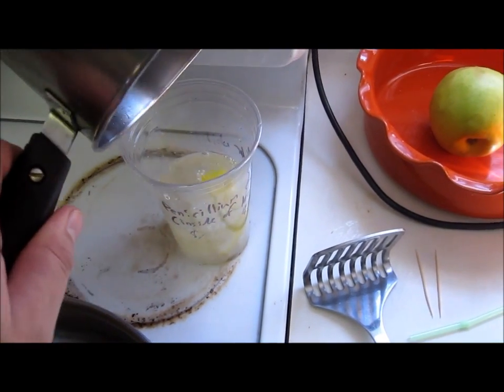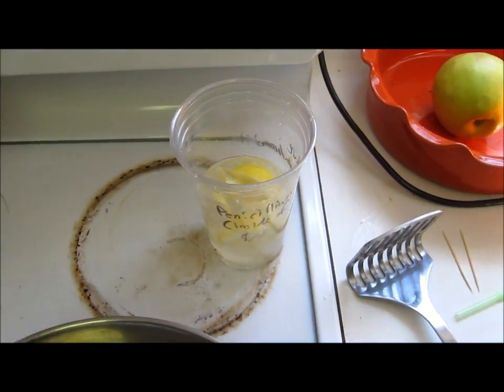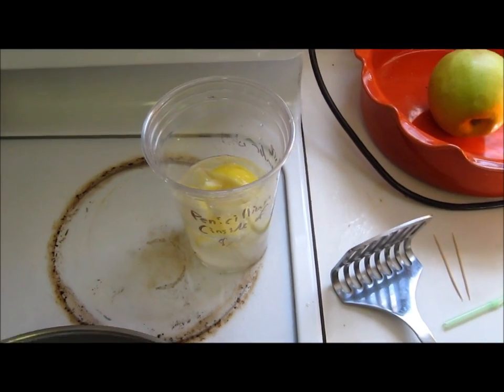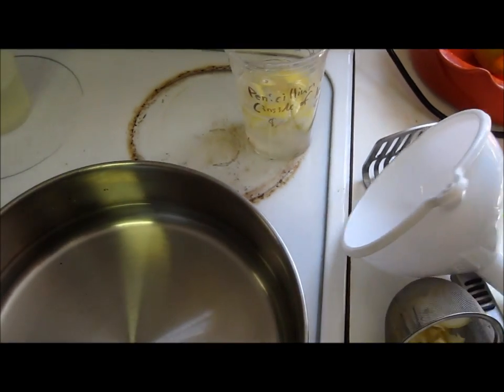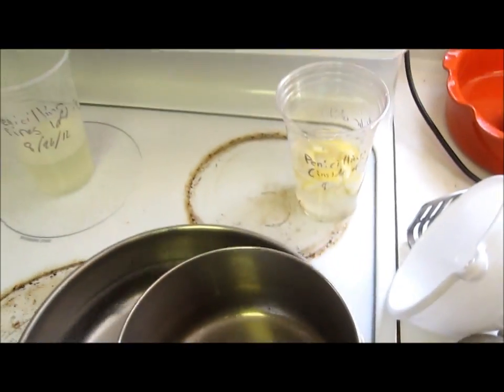The sort of control one is going to have everything in it. That's enough peels. Put this aside, put this aside, get this out of the way.